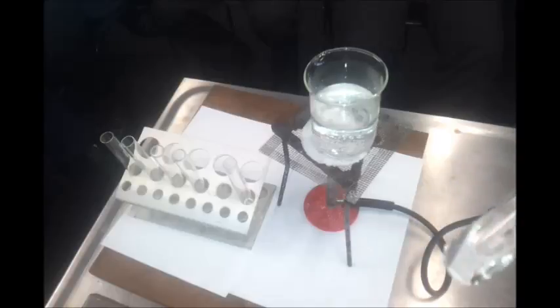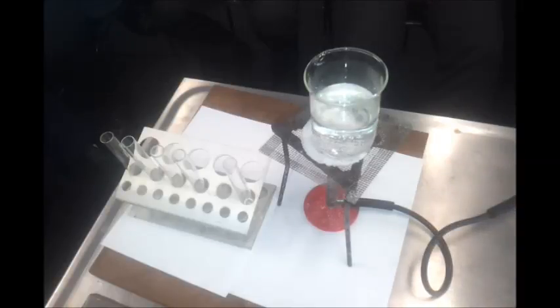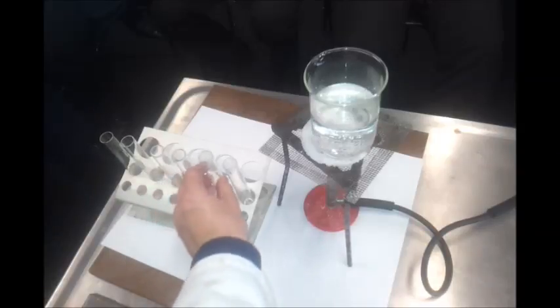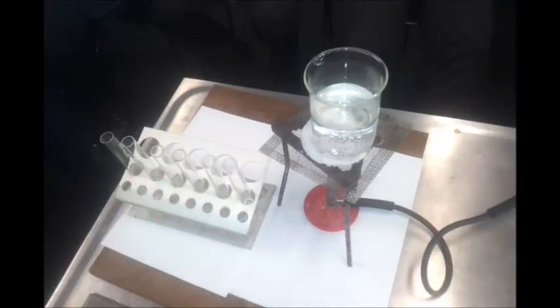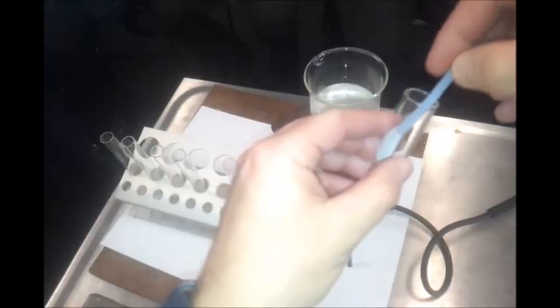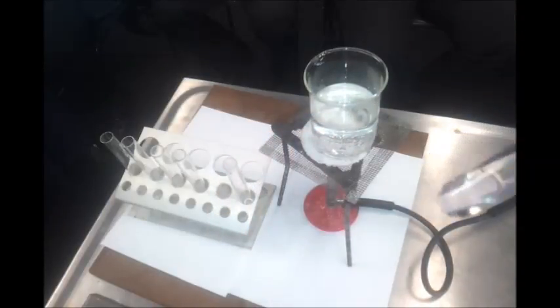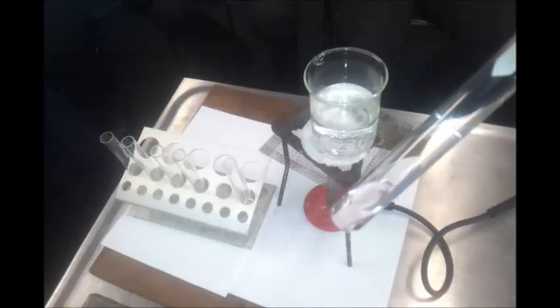So, okay, maybe it isn't the OH that it can lose when it dissolves in water, maybe it can lose the hydrogen. So let's put a bit of blue litmus in there as well to see if that has any effect. And again, no change to the blue. So if neither of them change, what does that tell us about the pH?